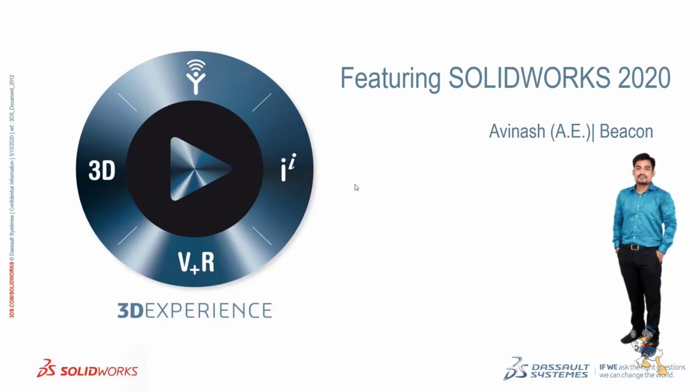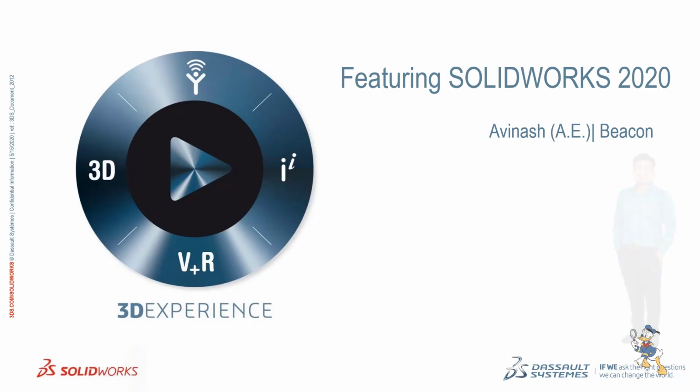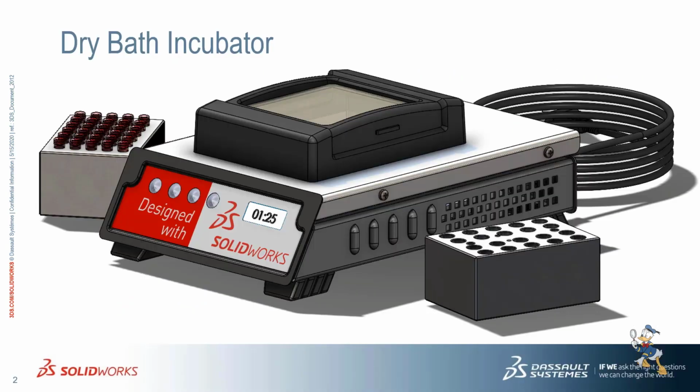Today we are having an interactive session about how SolidWorks plays a vital role in the medical industries. So, today we have a model known as Bath Incubator. This device works as heating equipment, and we can set a temperature for some time, and it can test blood samples and DNA samples for medical purposes. So let's see how this kind of model can be designed using SolidWorks.